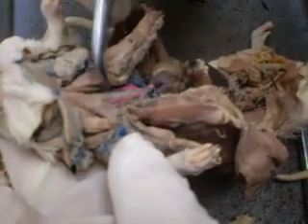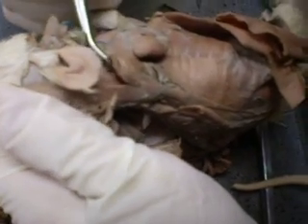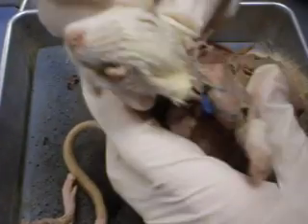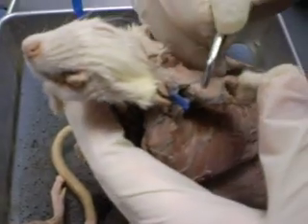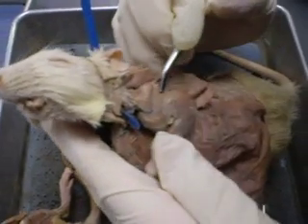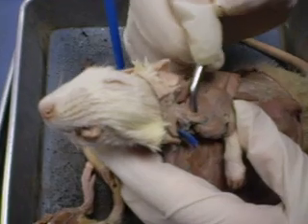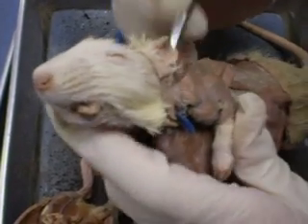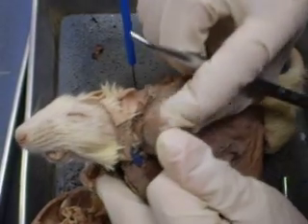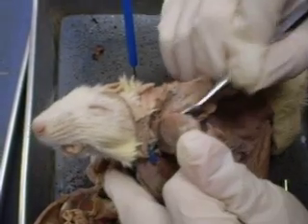Okay? And then you know your cervical trapezius. You have your spinodeltoid. Your cleidobrachialis is what's bordered by the blue veins. You have your omotransversalis, this strip of muscle right here. You have your cutaneous trunci, the one that sticks to it.